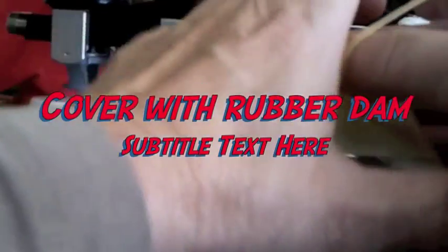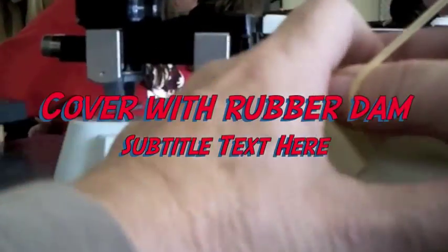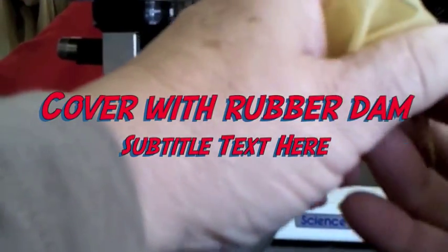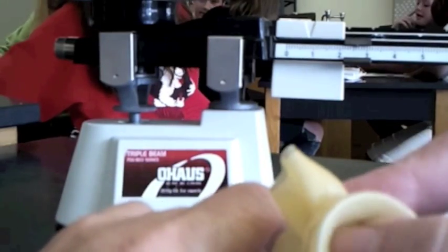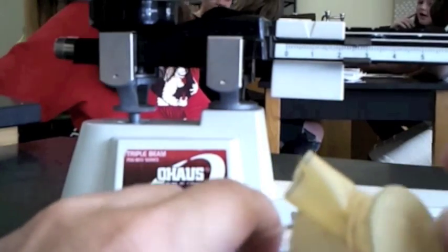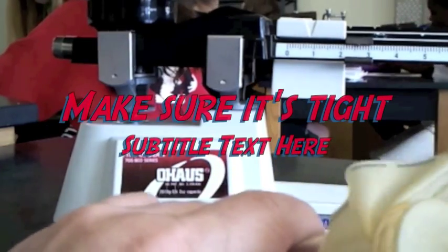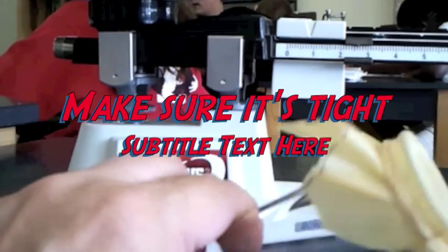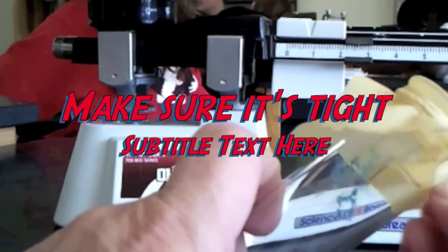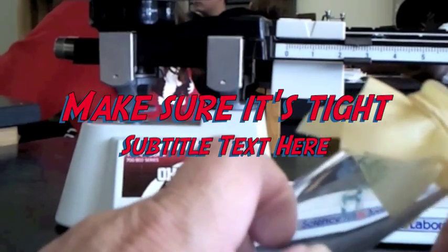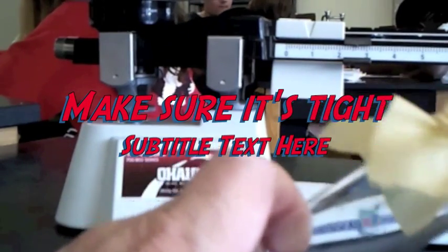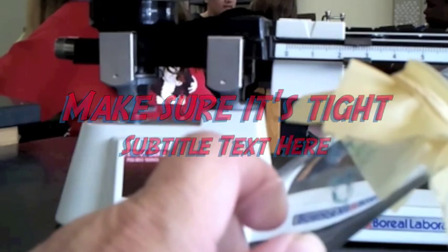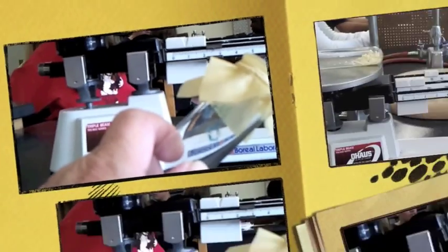We're going to cover it with a rubber dam. This allows expansion of the air inside the test tube without allowing any of it to escape because you'll remember we want to keep a closed system. I'm going to check to make sure it's tight. You don't want it to fly off. Sulfur is not pleasant when you heat it. It smells pretty bad.